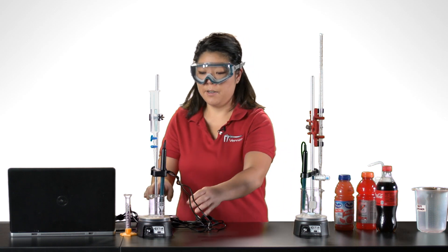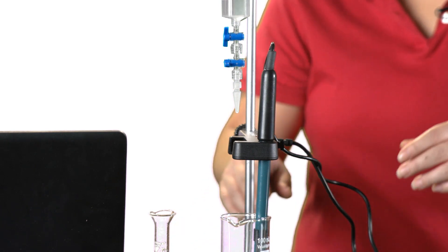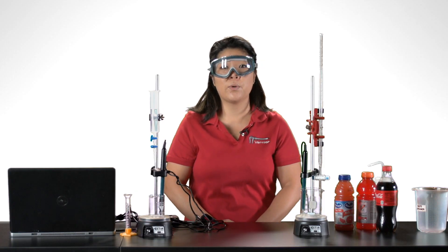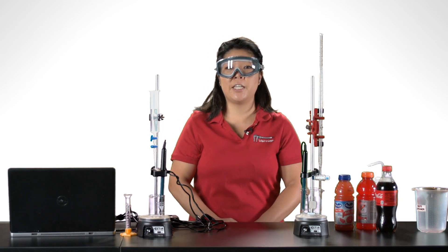The setup here uses a Vernier drop counter and pH sensor. The drop counter will automatically record the volume at each pH reading.